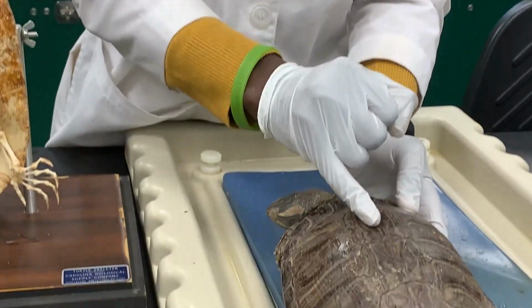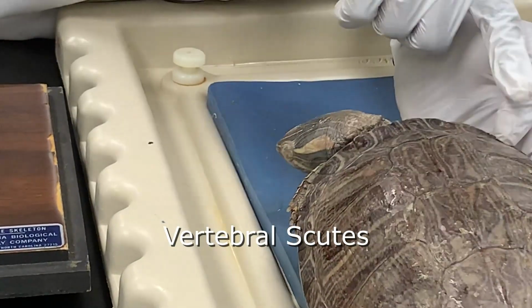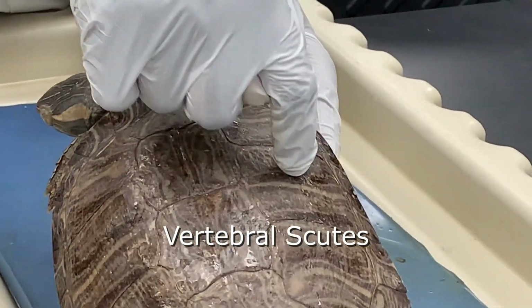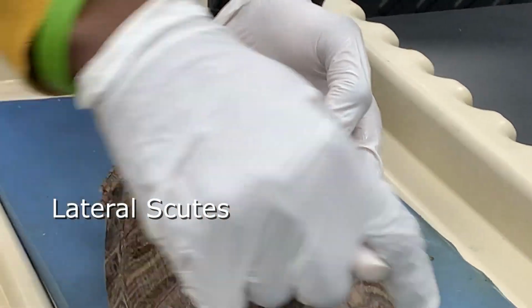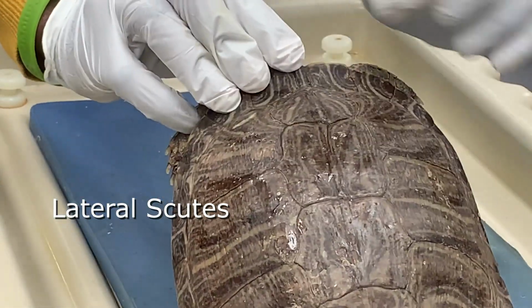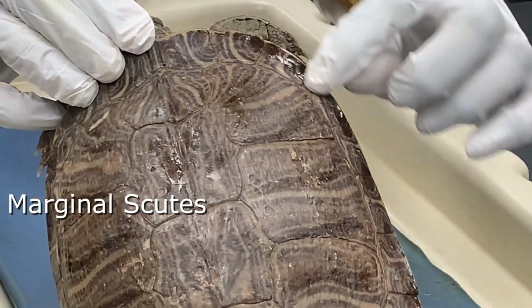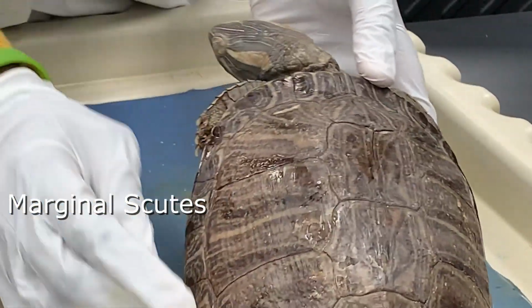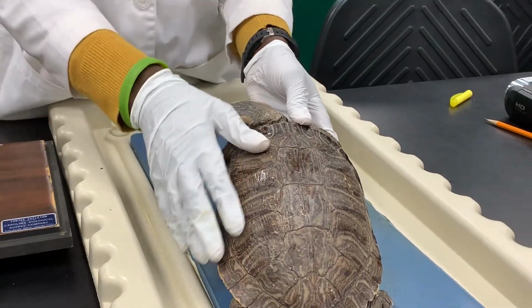Here we have the vertebral scutes, and on the side we have the lateral scutes, and towards the margin you have the marginal scutes.